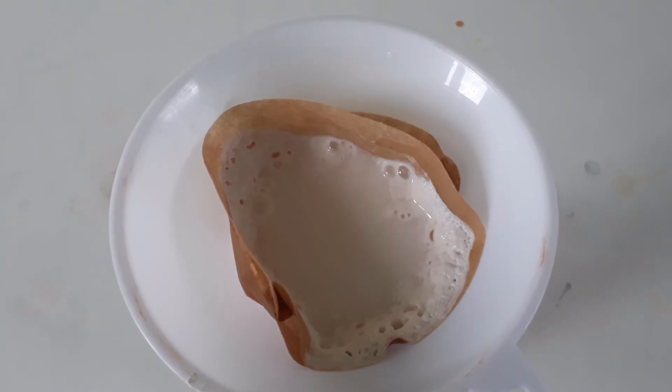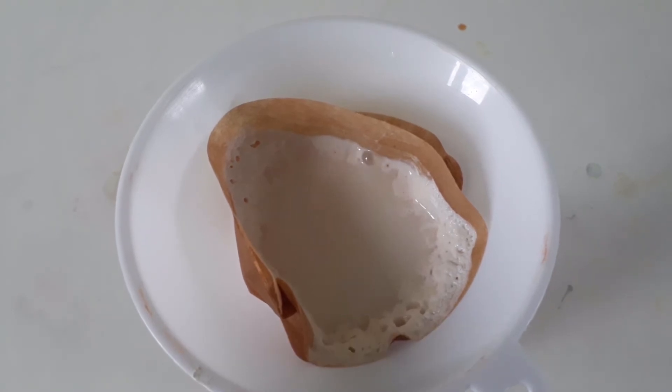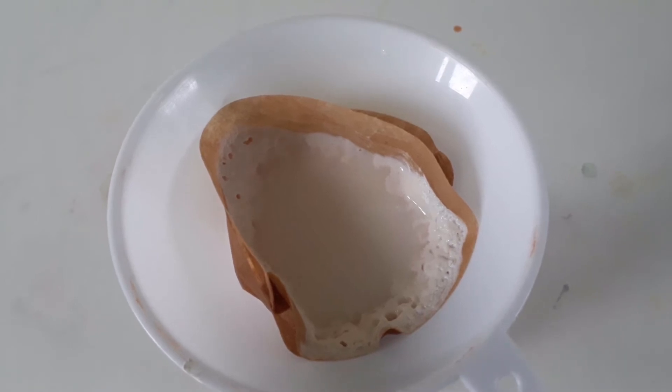While filtering, a lot of bubbles are evolved, which is oxygen from the decomposition of excess peroxide and the reaction of calcium peroxide with water. The reaction of calcium peroxide with water actually also produces calcium hydroxide, which is an insoluble solid which will also be present in our end product.